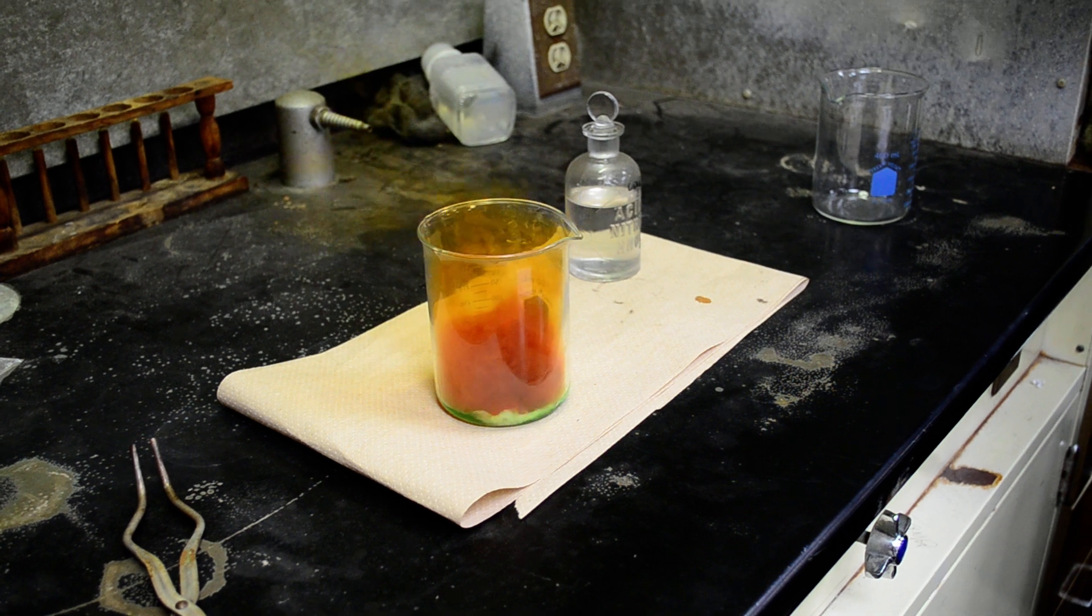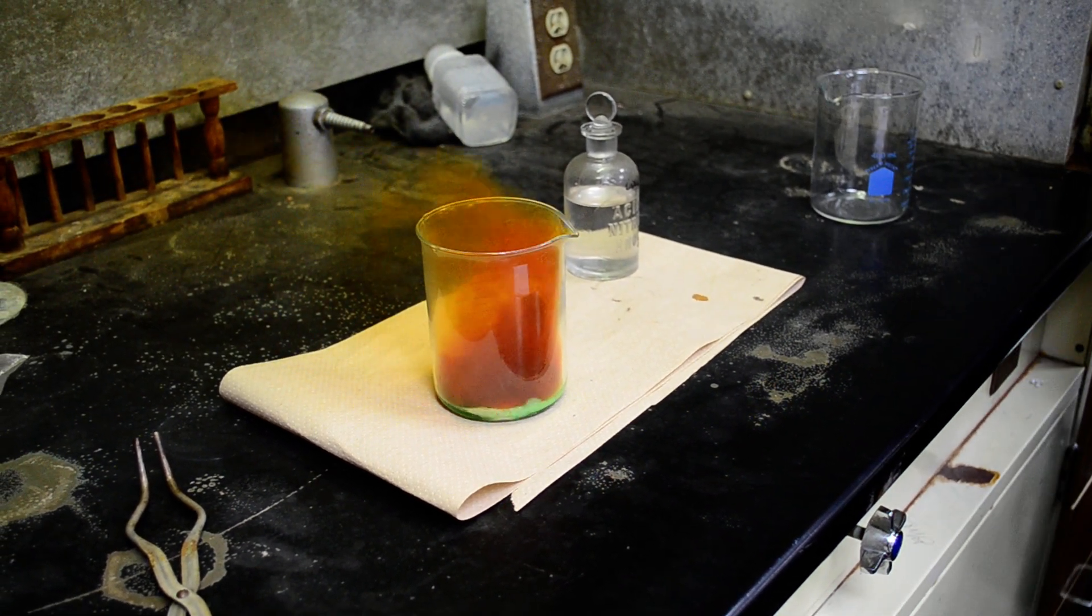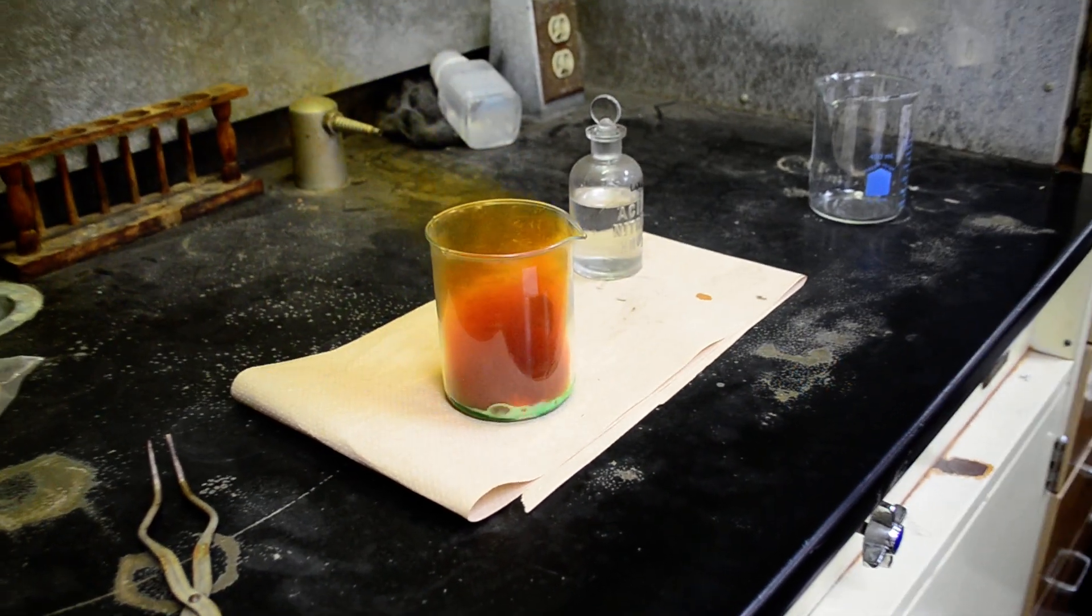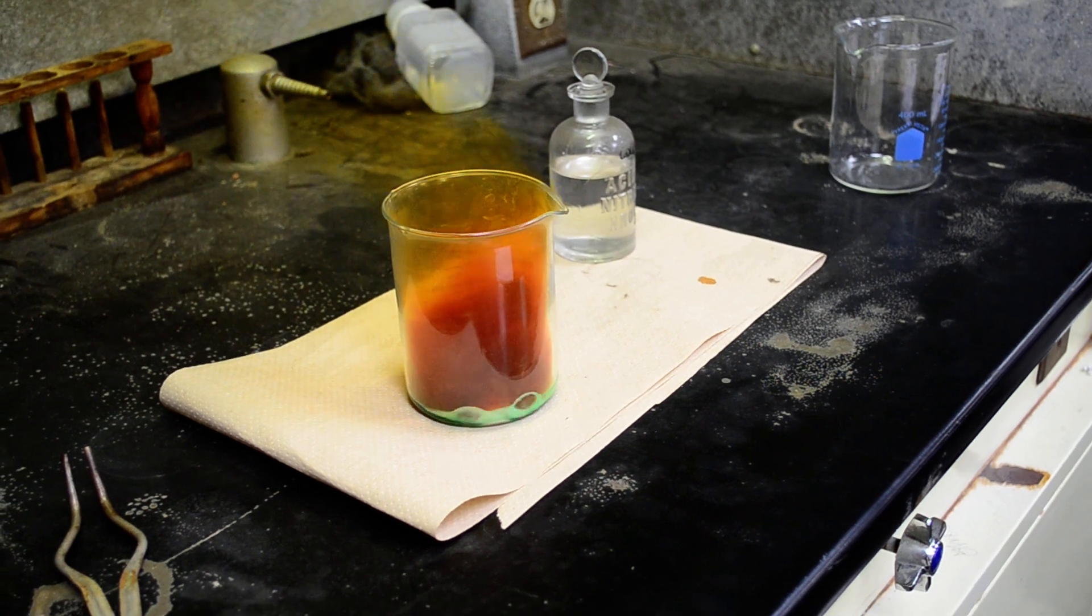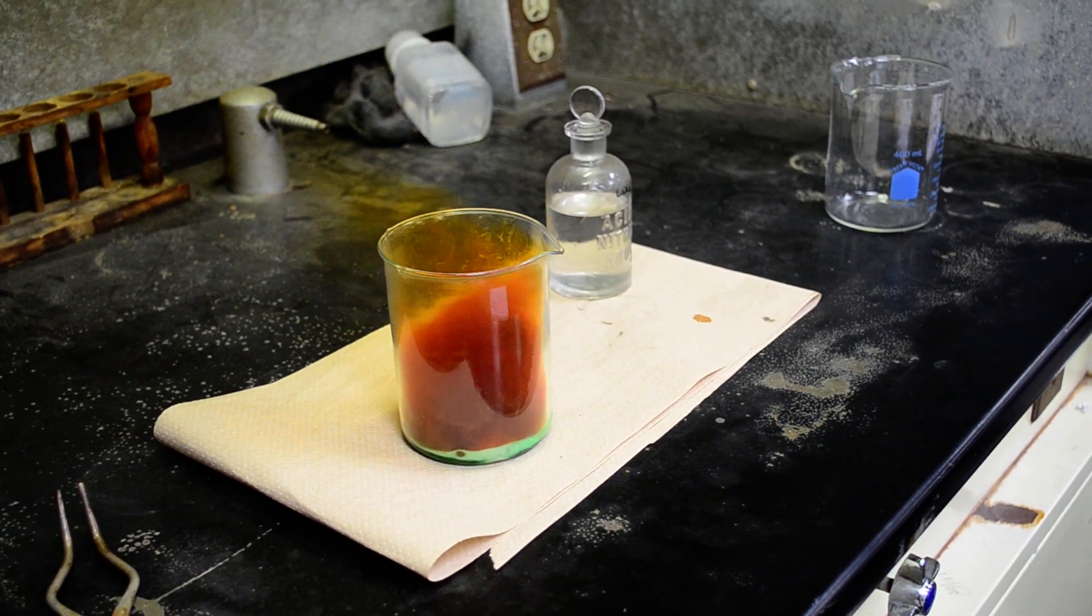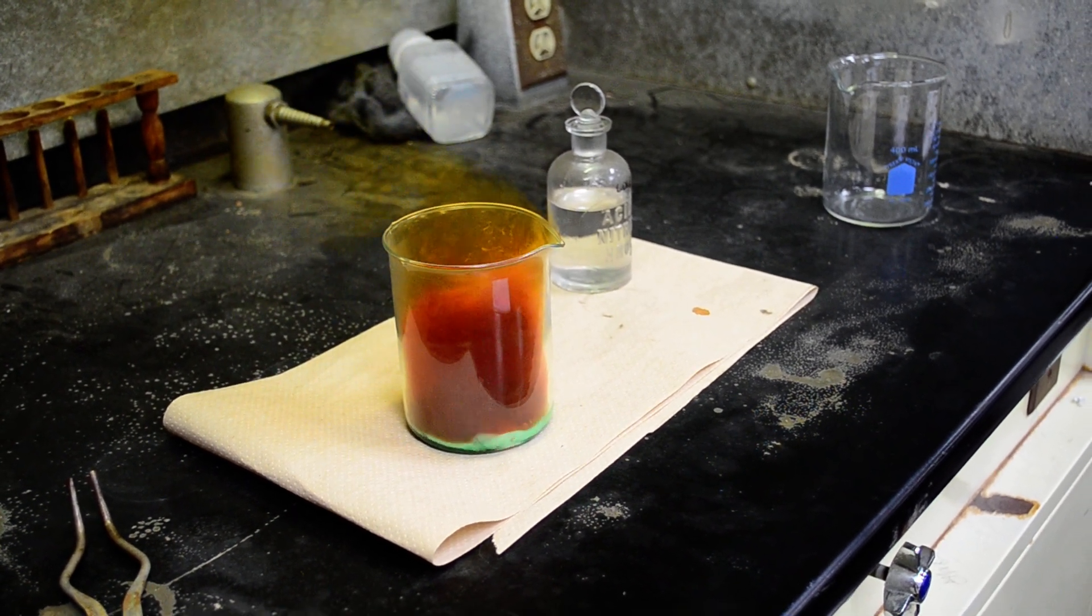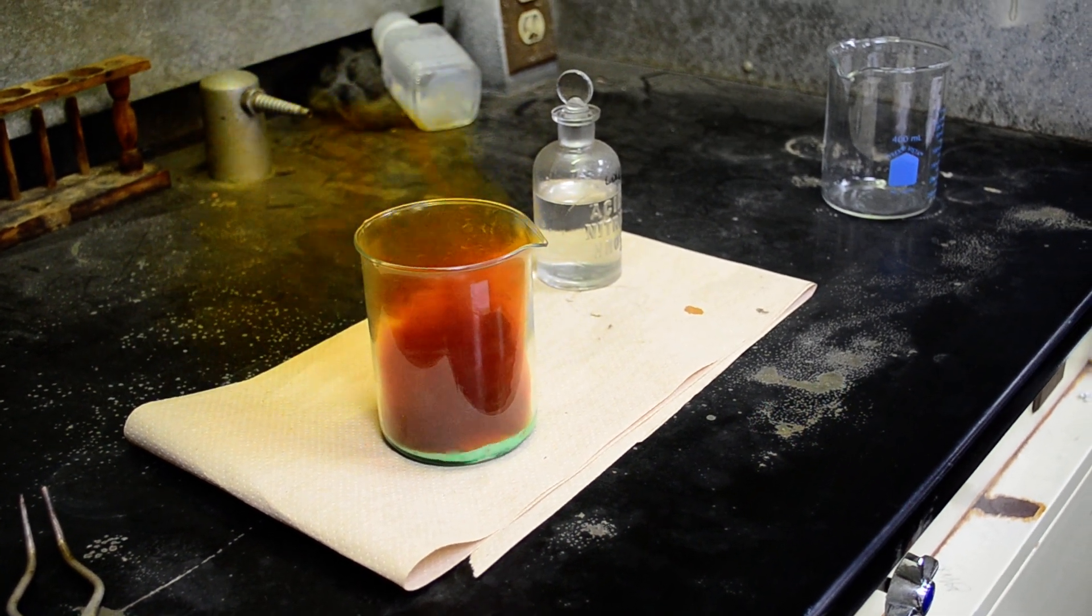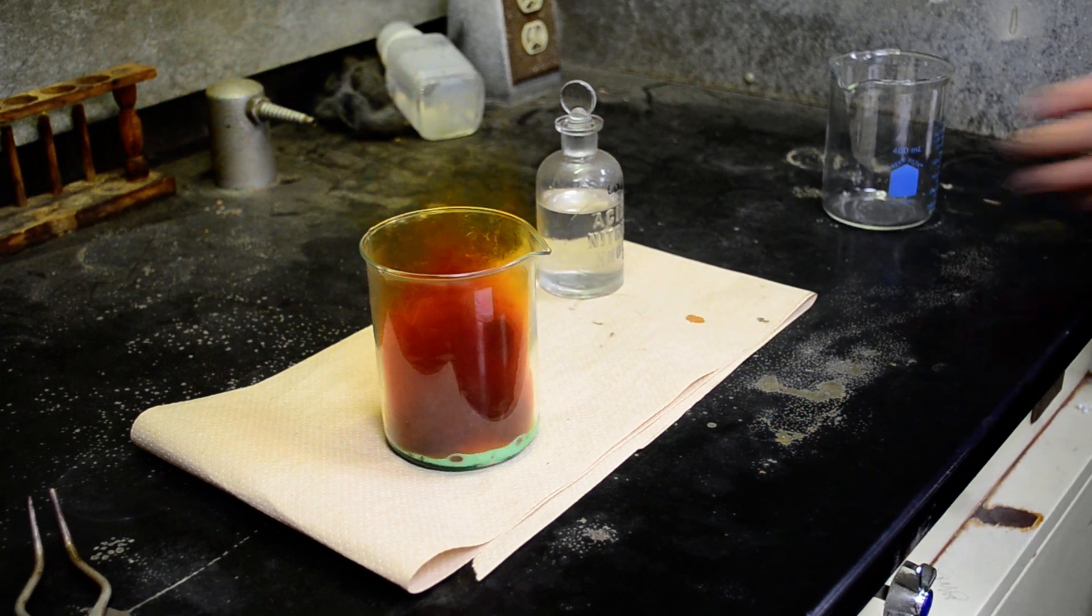Now, what you're looking at is the gas that is being produced. That's nitrogen dioxide. The nitrogen dioxide is not nice stuff. That nitrogen dioxide is what you see in smog. There it is up on the board. Wow, look at that baby go. That's a nice, strong reaction because that was concentrated nitric acid.